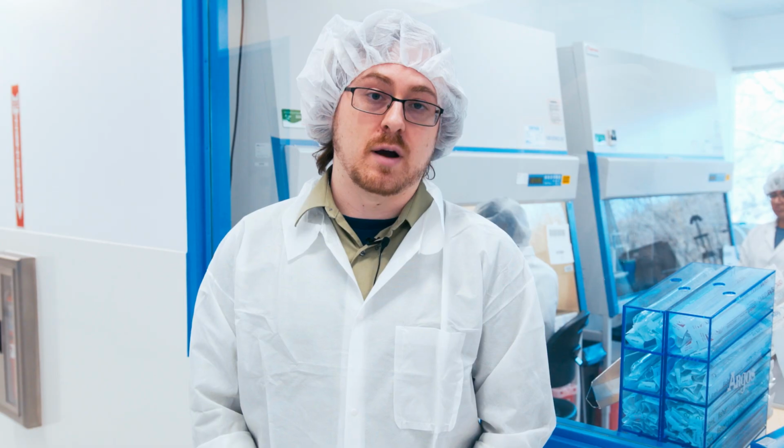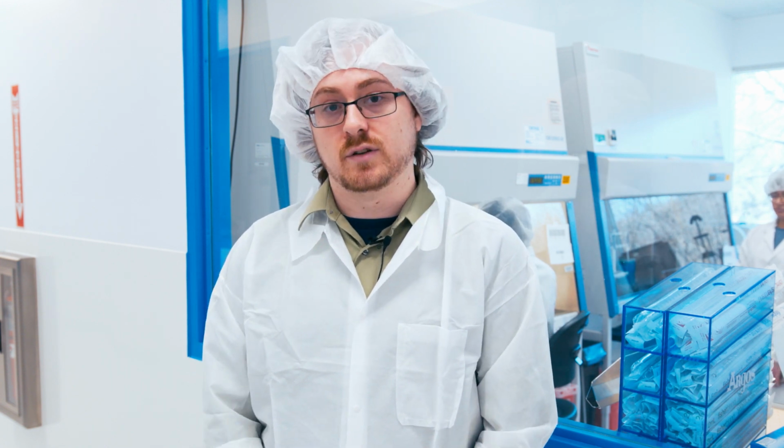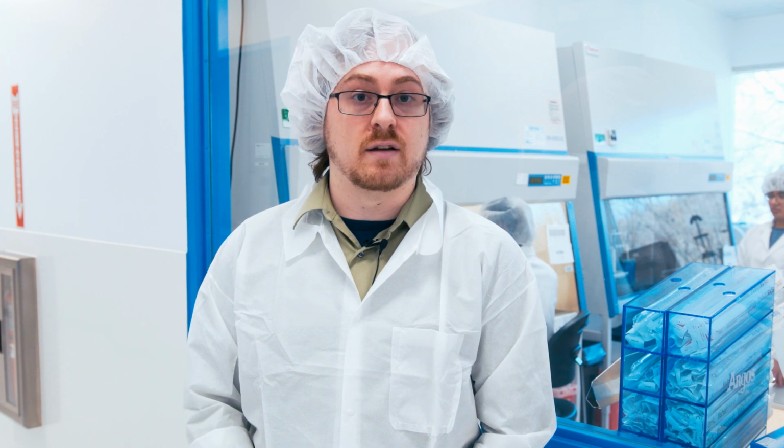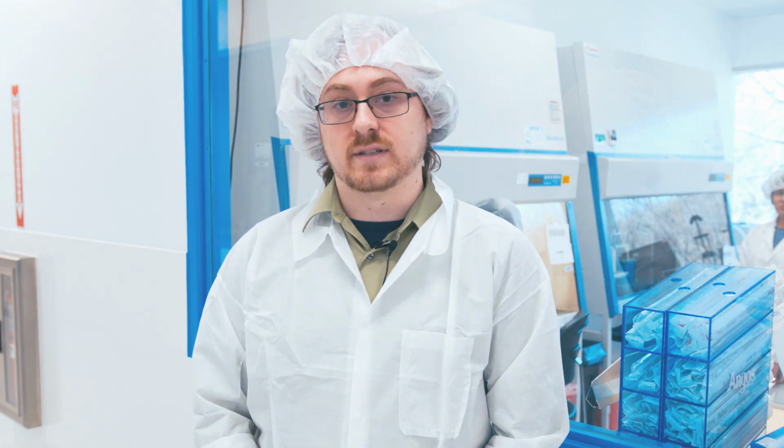This also includes proper environmental monitoring, where we would then plate and test to make sure that there was no growth on any of your gloves or gowning when going in and out of open processing.